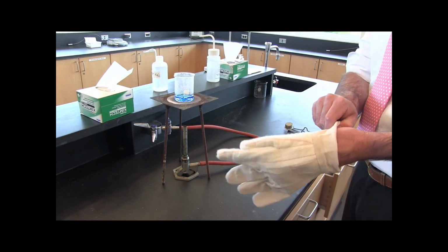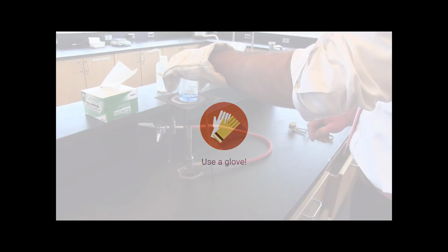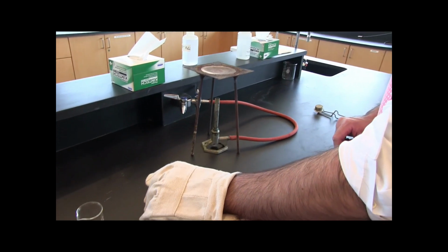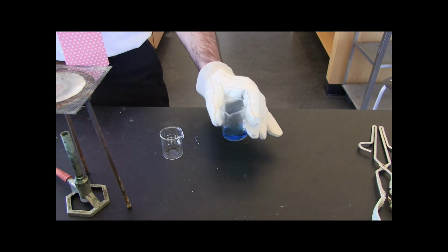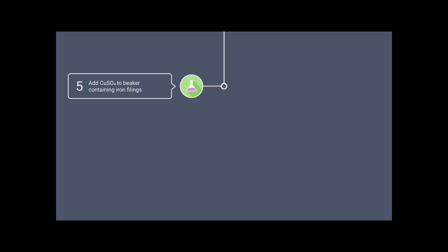Turn off the gas, put on a glove, and take the beaker off the burner. Don't forget that glove. The beaker is still really hot. Still using your glove, carefully add the copper sulfate solution to the beaker containing the iron filings. Our reaction between the iron and the copper sulfate is now beginning.